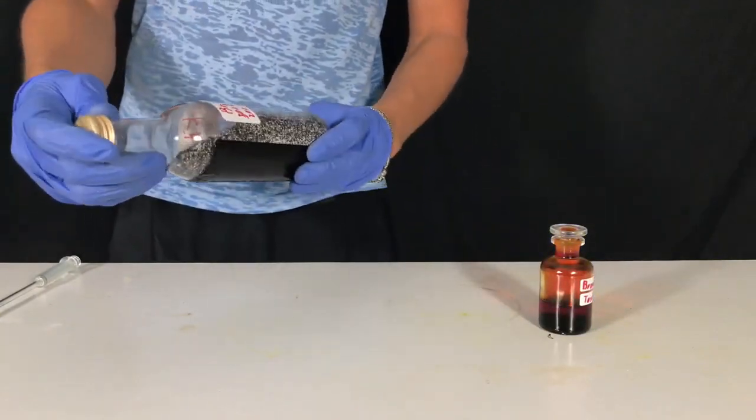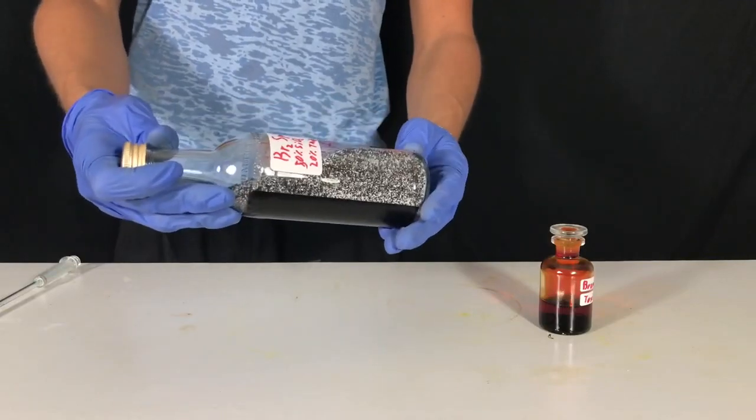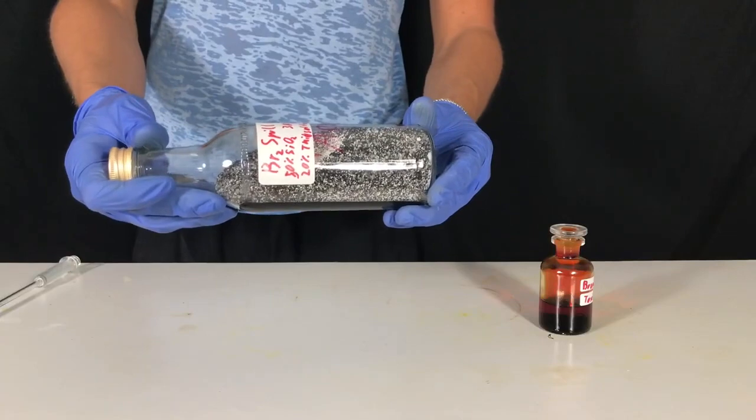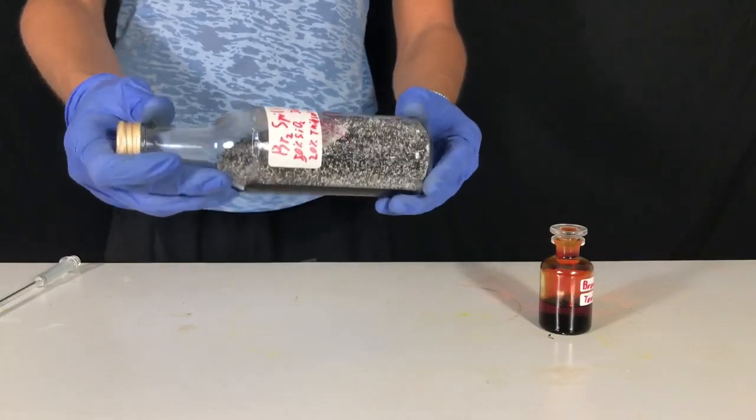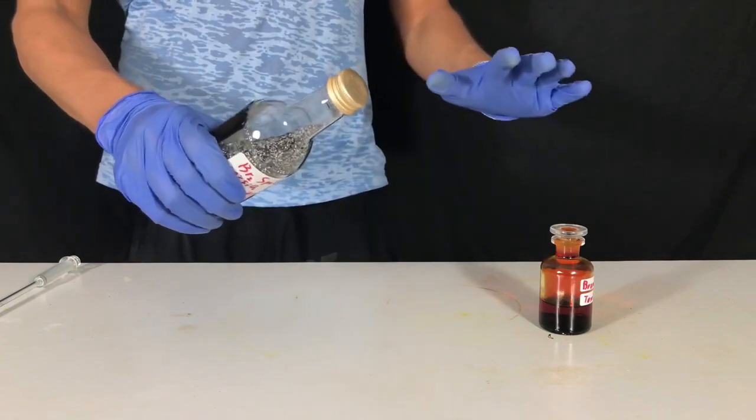What is this? Well, this is 50% sand, 20% sodium thiosulfate and 30% activated charcoal by weight. You sprinkle this onto your bromine spill and it sucks up all the bromine and all the vapors.